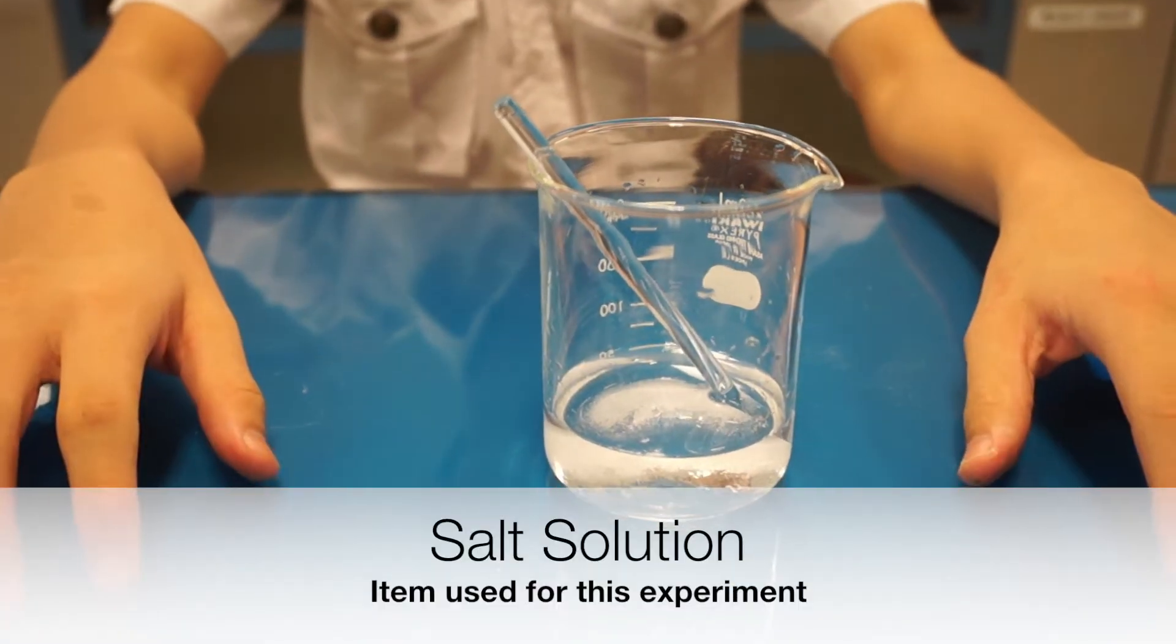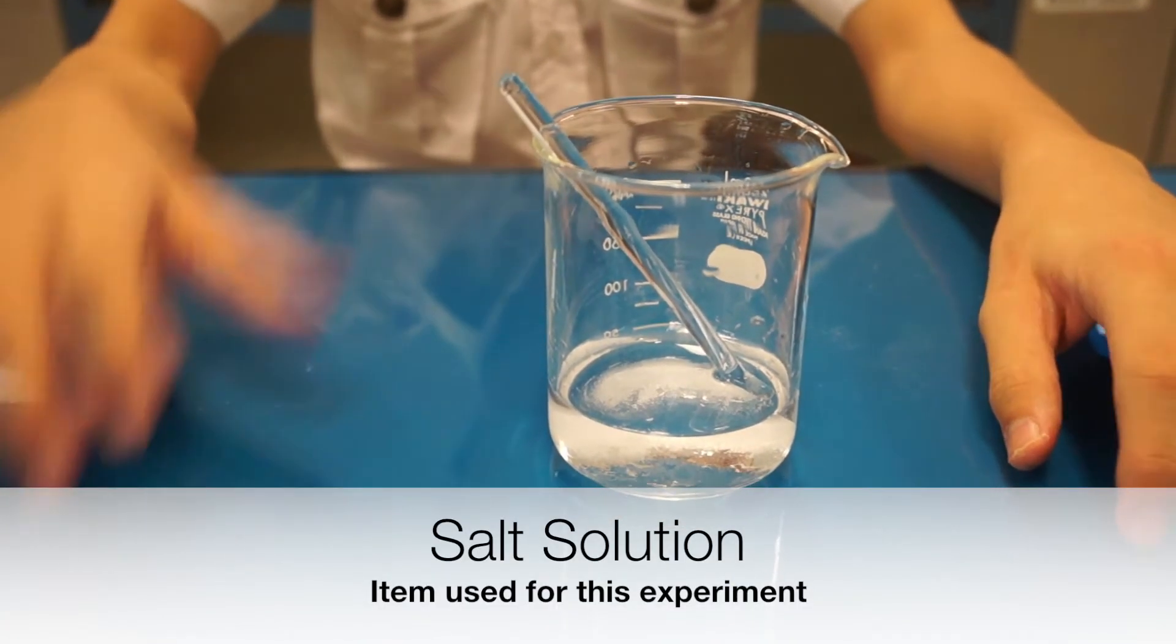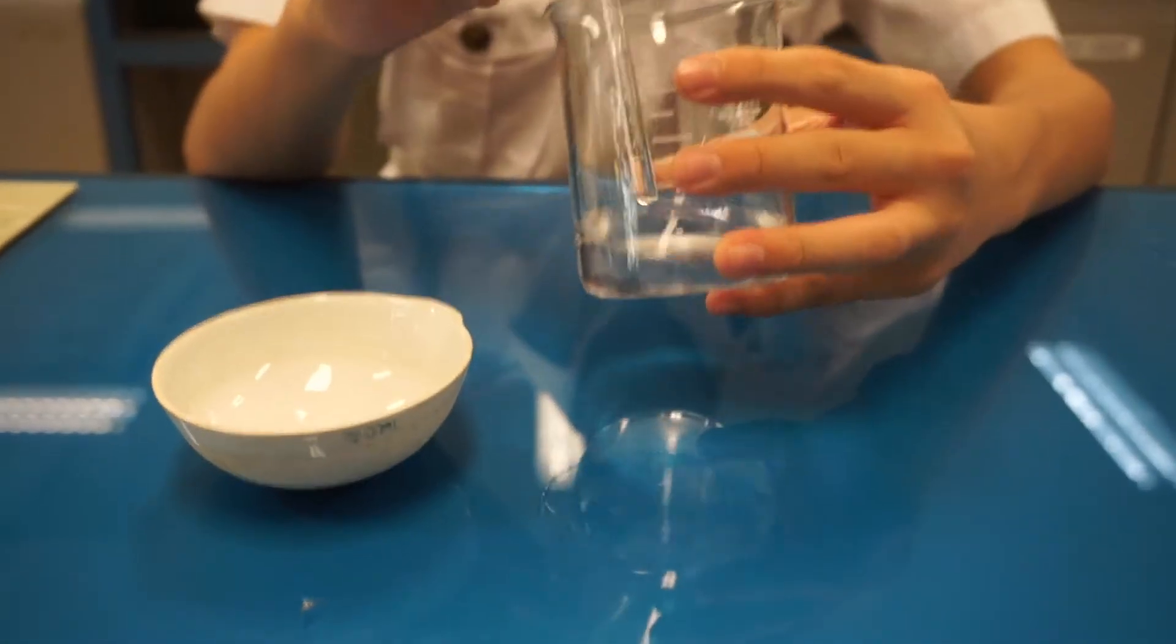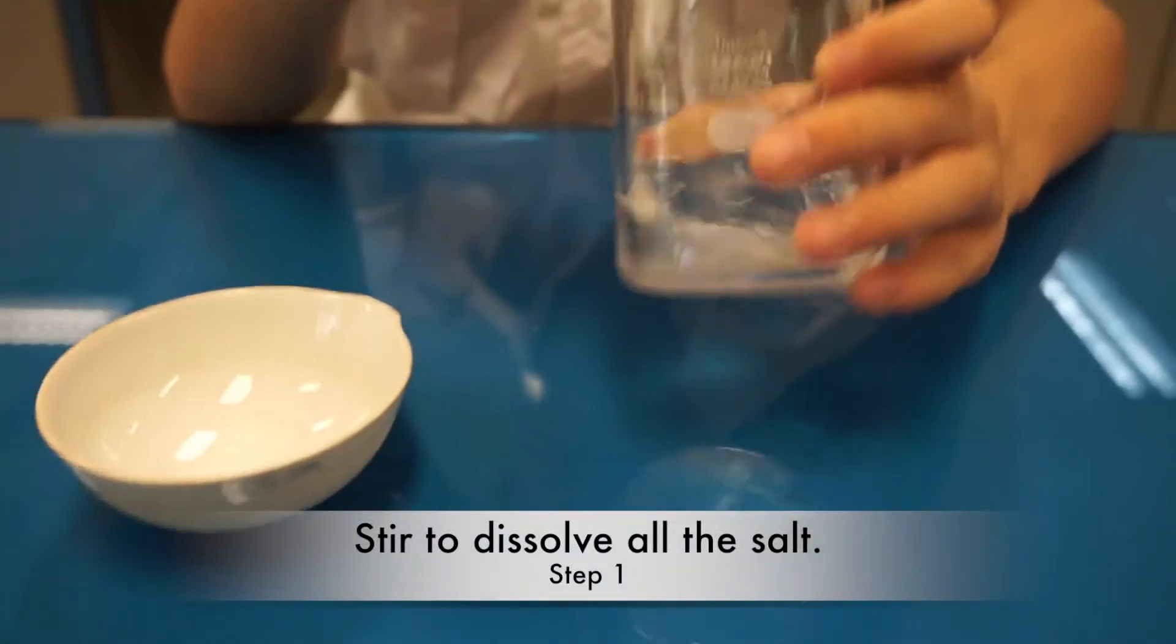For this experiment, we will be demonstrating Evaporation to Dryness using a salt solution. As we already have a solution of salt and water, we just need to stir it to dissolve all the salt.